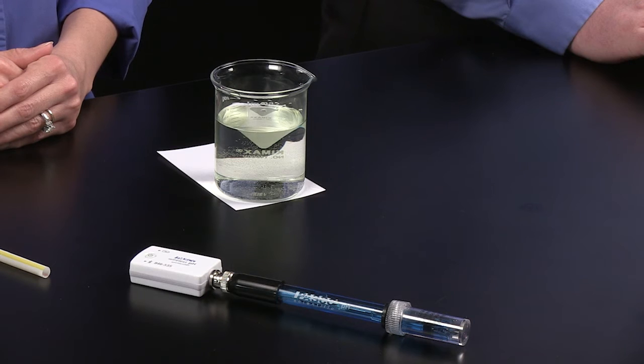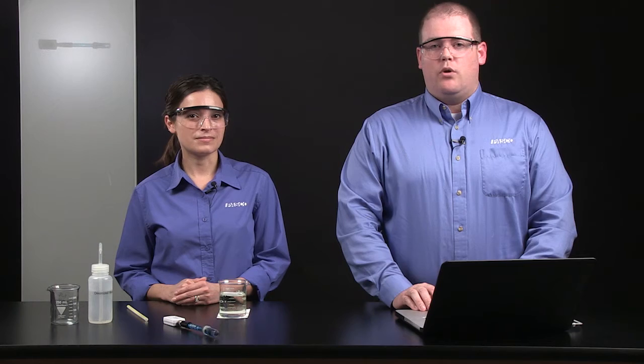Today we'll be looking at the wireless pH sensor. The wireless pH sensor has many applications for biology labs, including environmental monitoring, looking at the role of enzymes and buffers, diffusion, and today we'll be looking at dissolving CO2 in water.